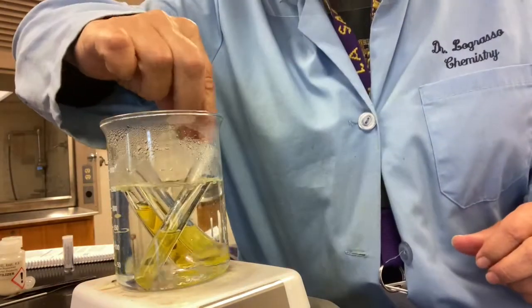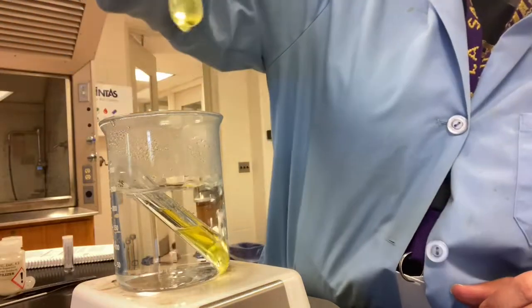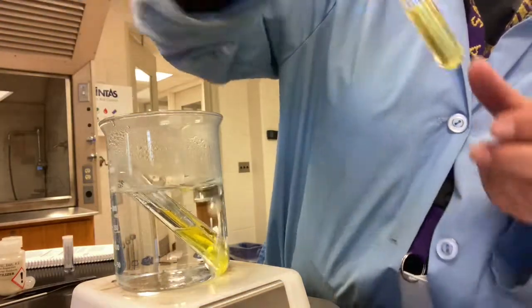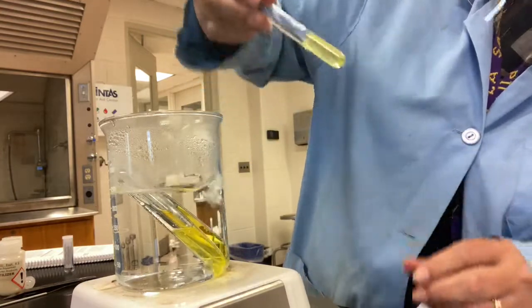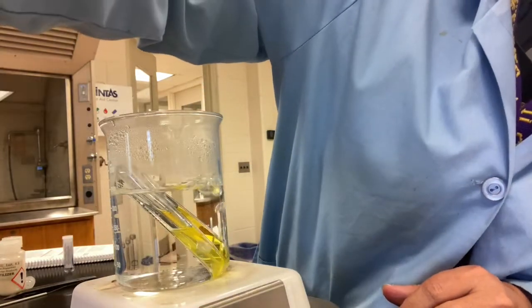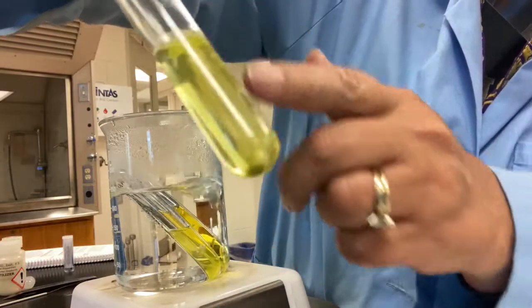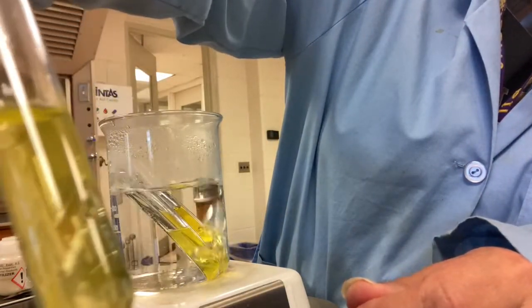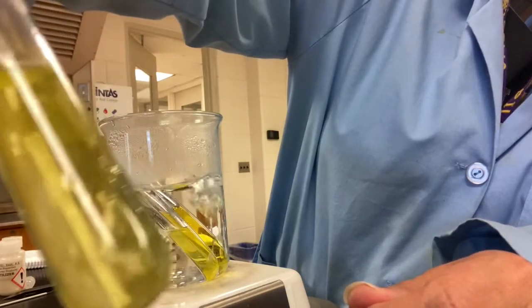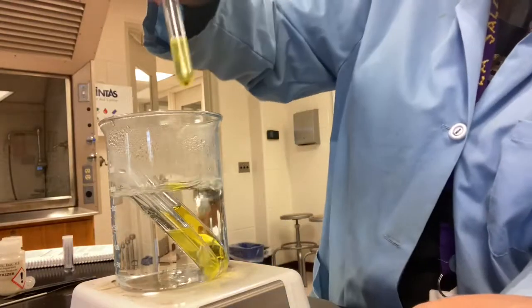I don't have any test tube holders, so I'm burning myself. Ow! And I don't, oh, you know what? I do see it in the fertilizer. Yeah. I think on the sides, if you see a little bit of deposit on the side there, it's cloudy. And that's not on the outside, that's on the inside. So there's a little bit of precipitate on the side in this fertilizer.